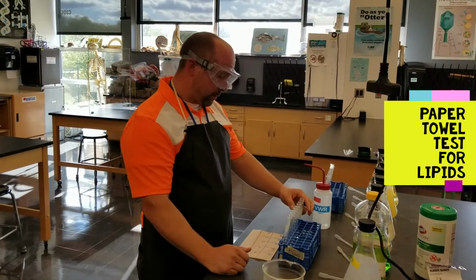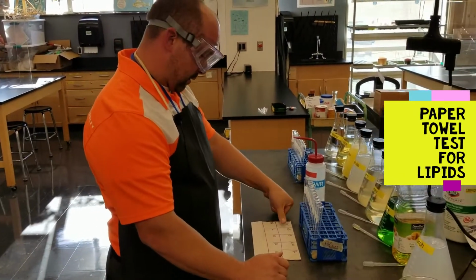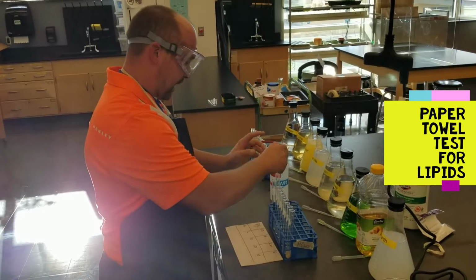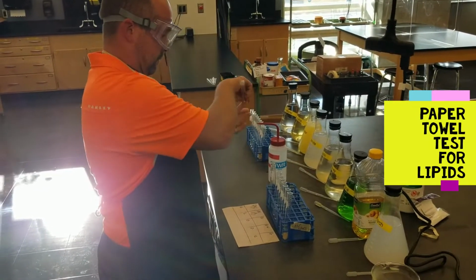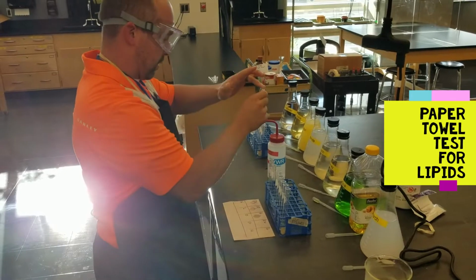To do that, we simply just go down each one of our solutions and just get your fingertip wet and put a drop on each piece. Make sure you change your fingers each time because we do not want to contaminate one sample to the next. And you're simply going to put a drop in the corresponding spot on the paper towel.